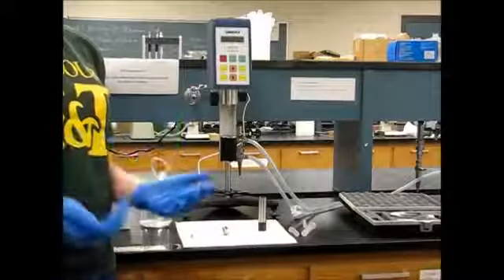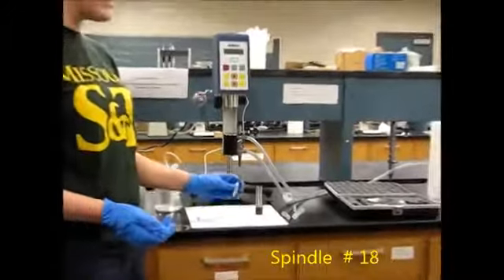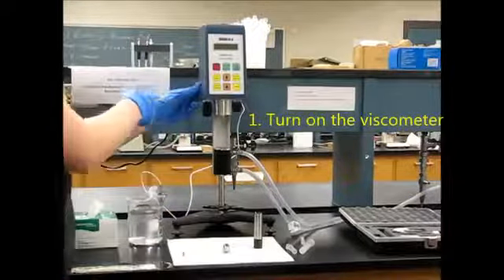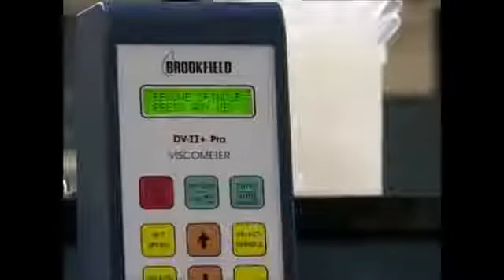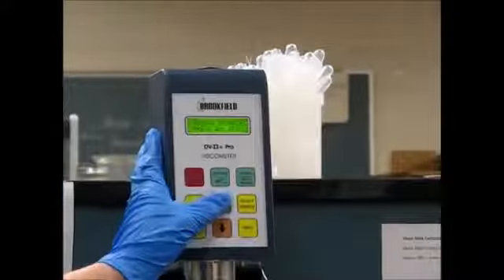So for the purposes of this experiment, we're going to use spindle number 18. It has an 18 on its stem. The first thing that we're going to do is turn on the viscometer with the on-off switch on the back of it, and we're going to follow the directions on this keypad. It tells us to remove the spindle. We don't have a spindle attached, and then it says press any key. So I'm going to go ahead and press a key.